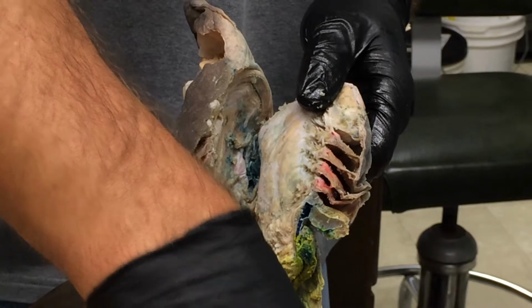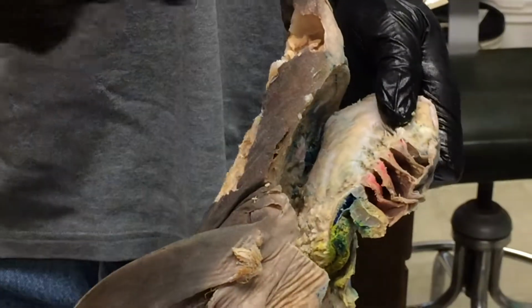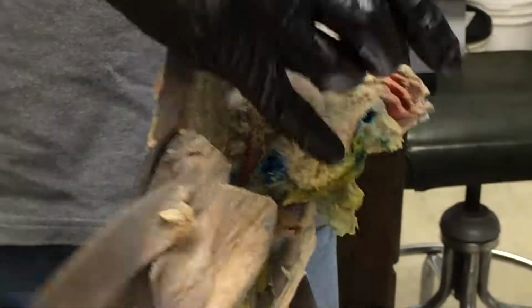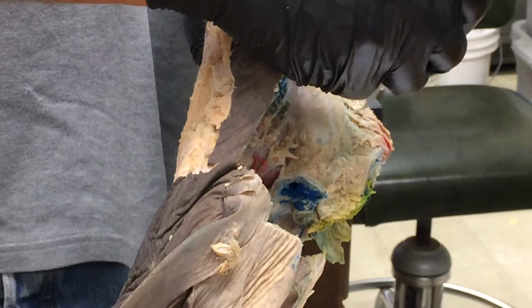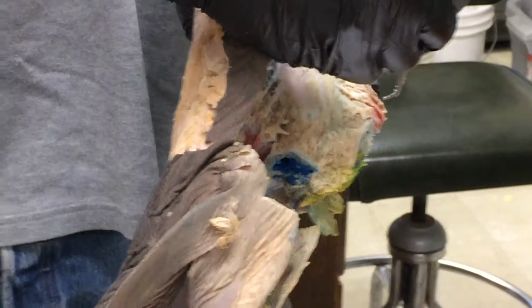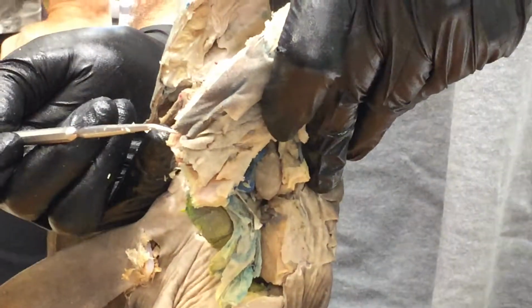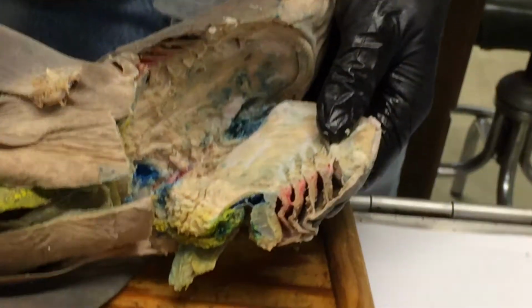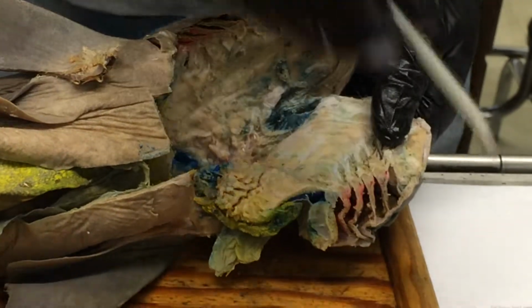Okay, branchial pouch, parabranchial chamber, external gill slits. I think you kind of got that one. Interbranchial septum is kind of a funny term. Basically, it refers to this whole flap of tissue between one branchial pouch and the next. So here and here are the pouches. This whole thing is the septum, a partition between them. So again, this whole thing here is that septum. Right there. Okay. So it's a useful term. A septum is a partition, like the nasal septum separates the two nasal cavities. It's just a wall.